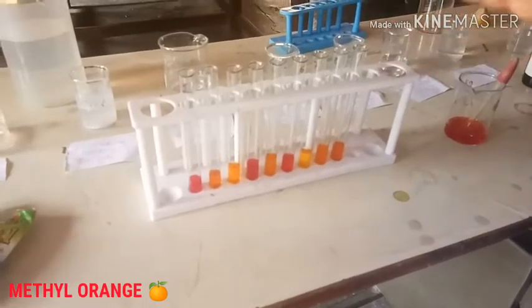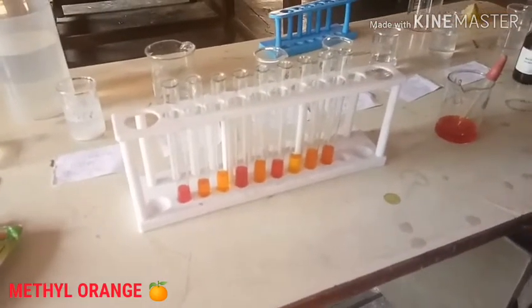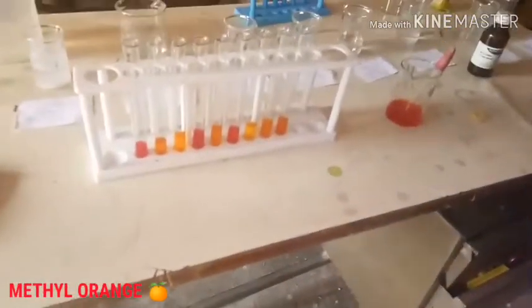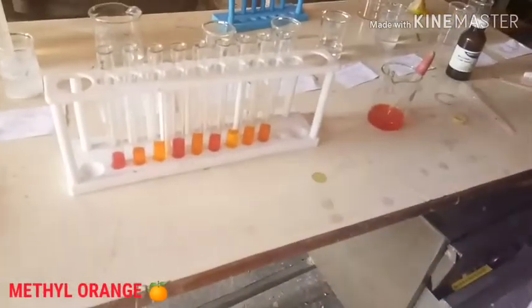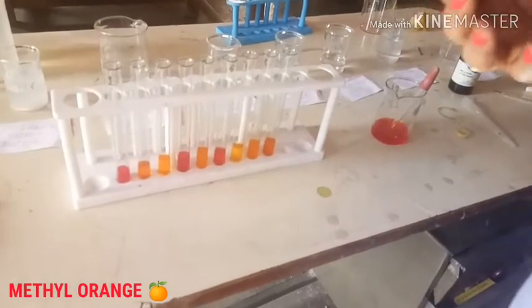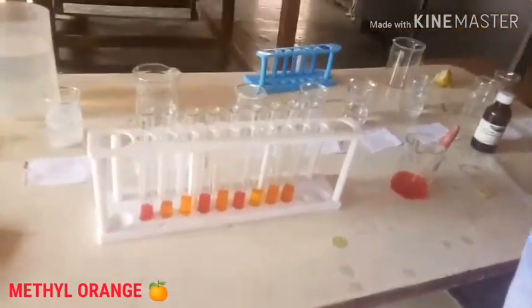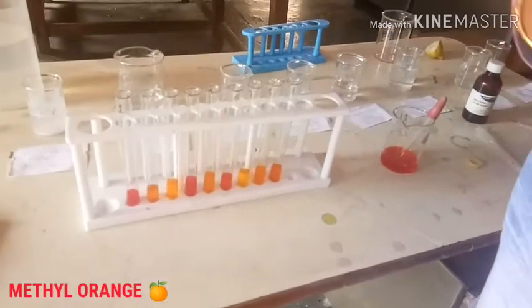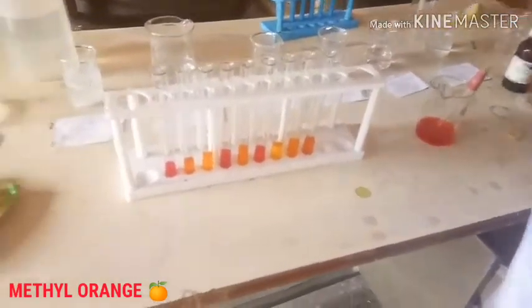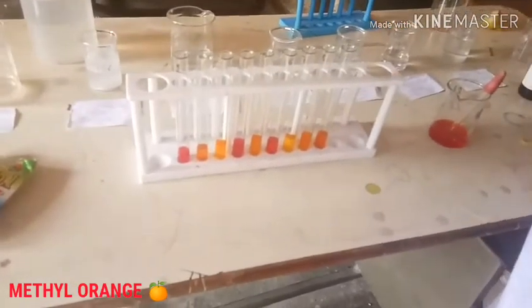So in this video, I have experimented all our 9 samples with the 4 indicators, to show you how you can differentiate between acid and base. Acid and base are both colorless, so we use indicators here to differentiate them.